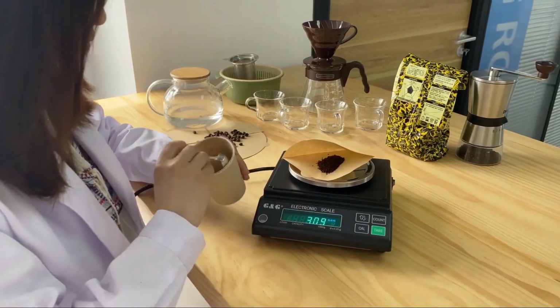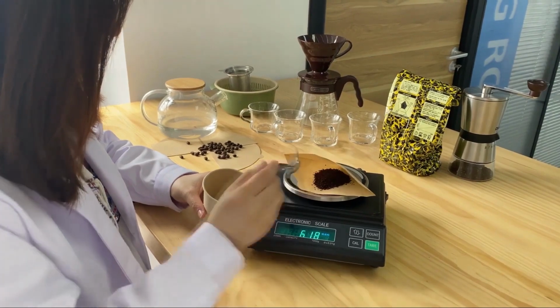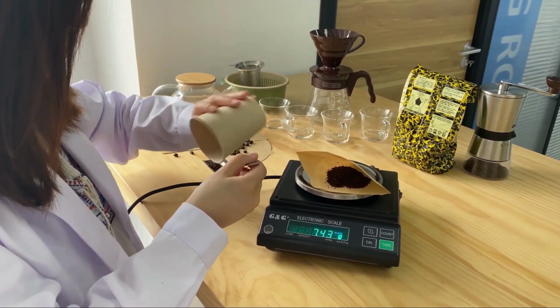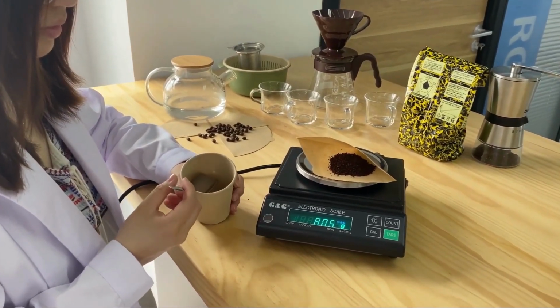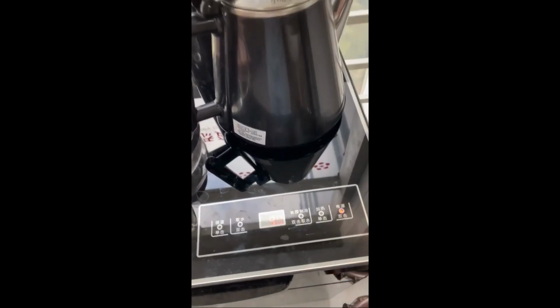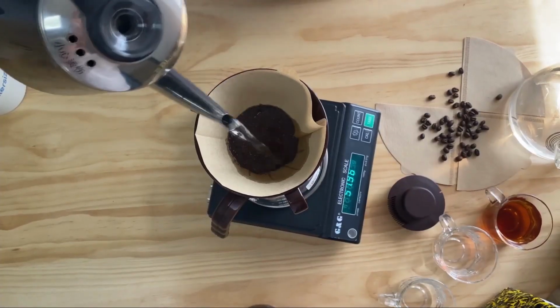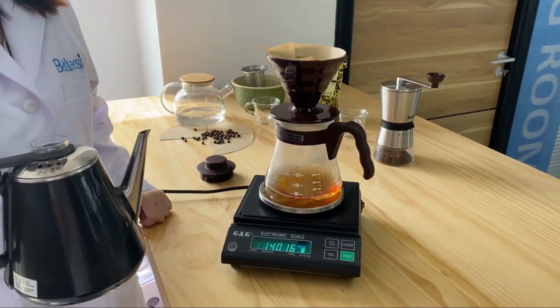Let's brew the coffee to see how coffee particle sizes affect the taste. For this specific type of coffee beans, it is recommended that for 8 grams of coffee, 140 milliliters of water is used for a perfect brew. To ensure that the only factor affecting the taste of brewed coffee is the particle size, we control the mass of ground coffee around 8 plus and minus 0.1 grams for all 4 grinds, and the water temperature is maintained at 90 degrees Celsius. A balance is set up to control the amount of water used to brew the coffee is around 140 milliliters. Repeat the brewing steps for all 4 grinds.